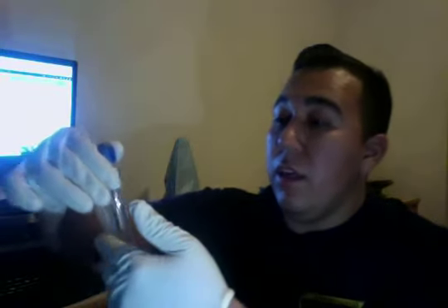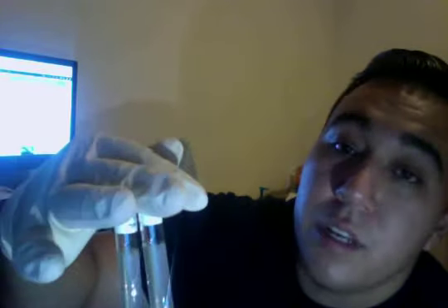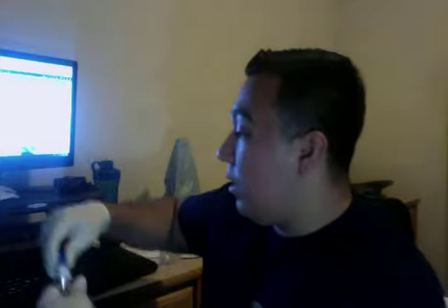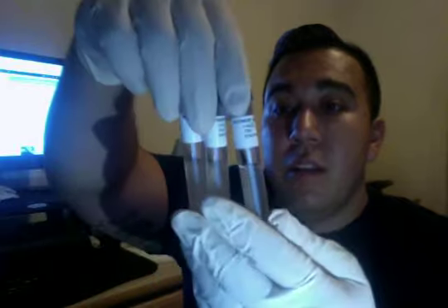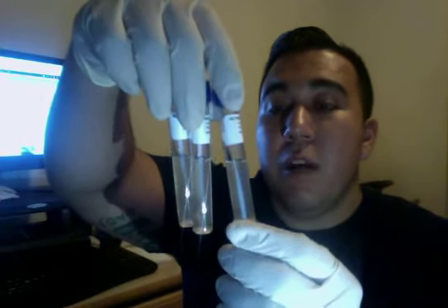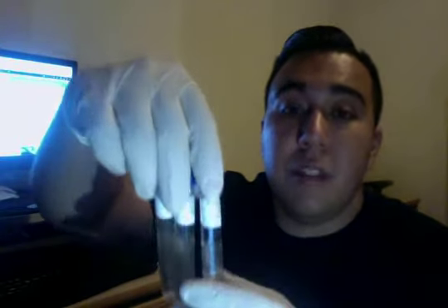And after 48 hours of incubation, of course after we put the cultured broths in all 3, to observe the results, I have a clear pH 5 and a turbidity in the pH 7 and the pH 9 with the epidermidis. And as far as the yeast, for the yeast, I had similar results, with the pH 5 being clear and the pH 7 and pH 9 being positive results for turbidity.